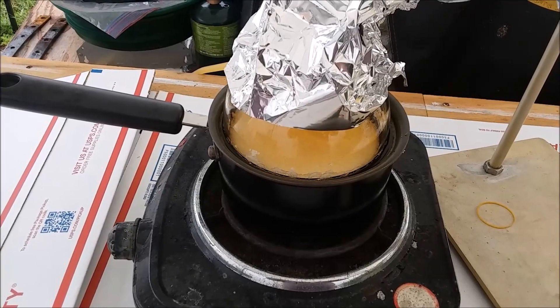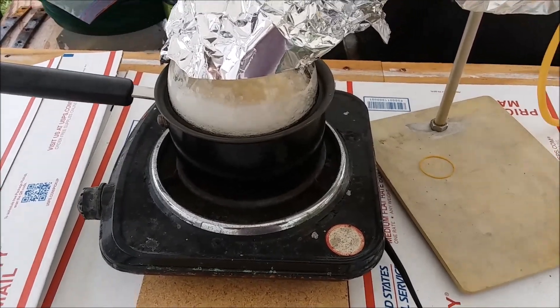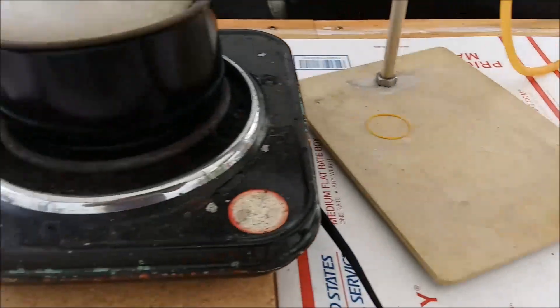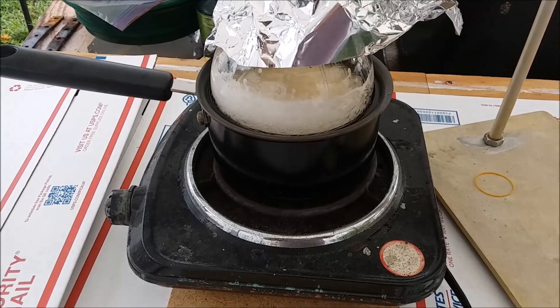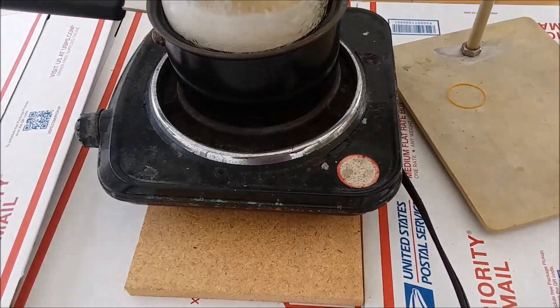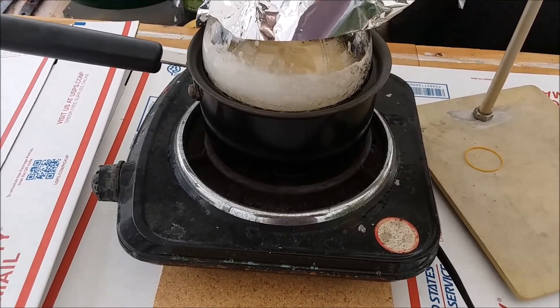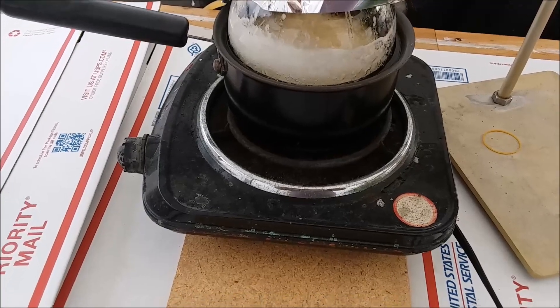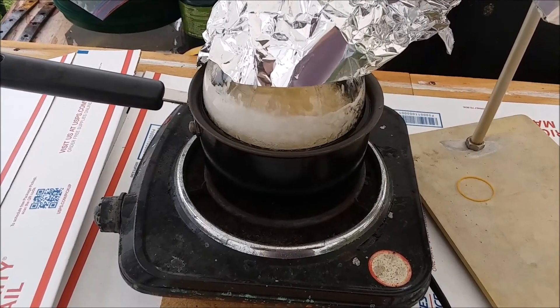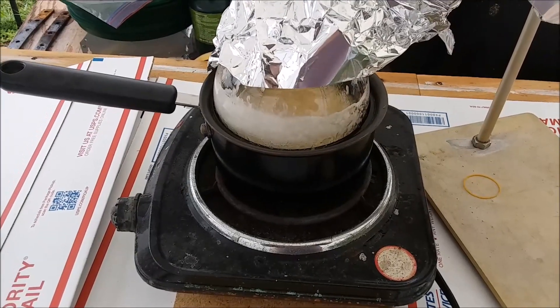Okay, this hot plate officially sucks. Everything seemed to be going so good. I walked away for a little bit, I come back and find it on the brink of boiling over. The temperature's way above 80°C, liquid's coming across at a crazy rate, so I turned it down again. I'm not sure why this thing isn't maintaining a more consistent temperature. Okay, it seems to be back under control again. That temperature knob is really touchy. I'm probably going to need a better hot plate. I could definitely use a two burner hot plate.